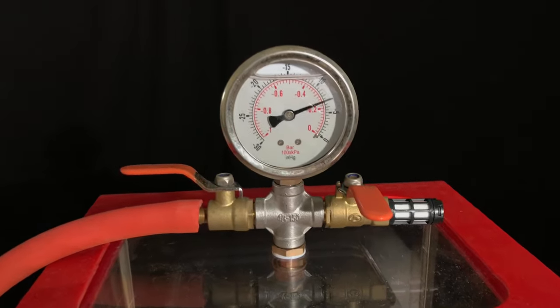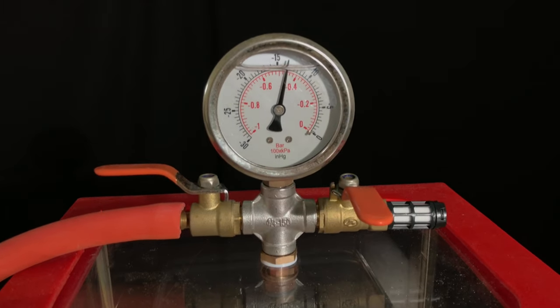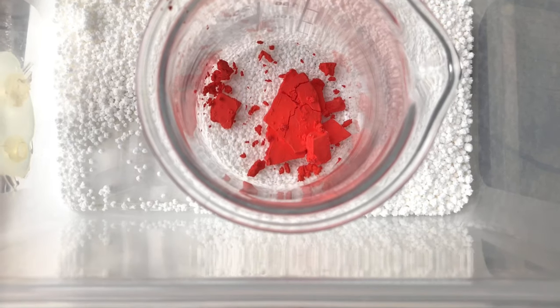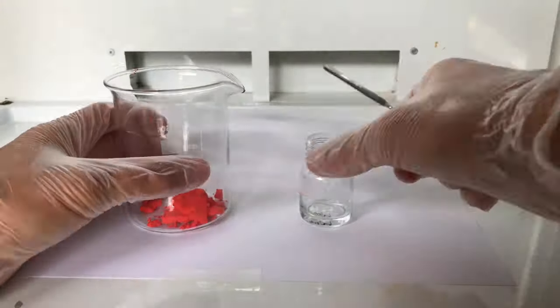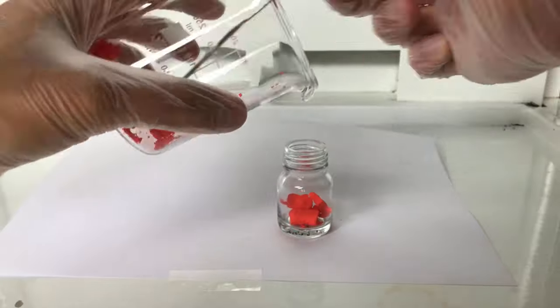Besides that, there's a nice benefit, you won't get any dust into your product. Once the powder had been dried for an entire day, we were left with this beautiful orange powder. In order to avoid inhaling any dust, the powder was transferred to a pre-weighed storage container under a fume hood.